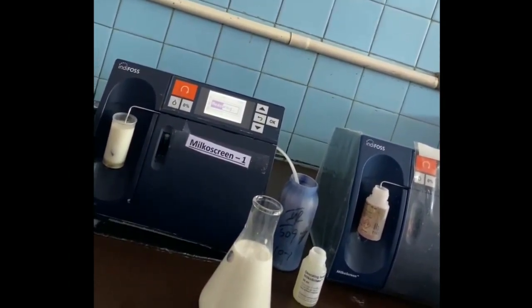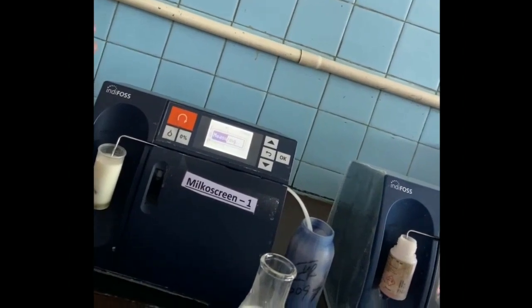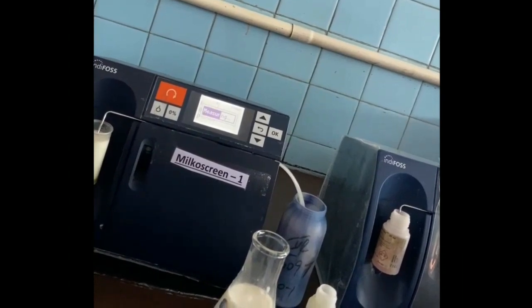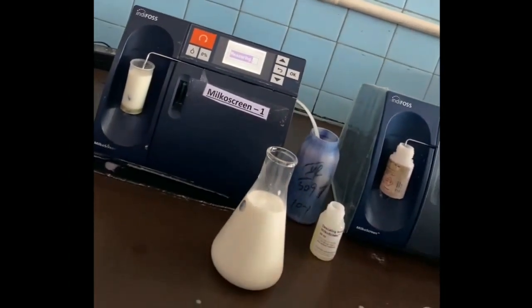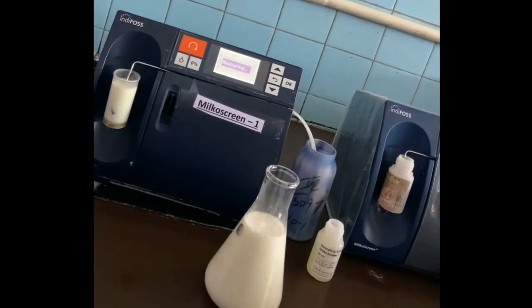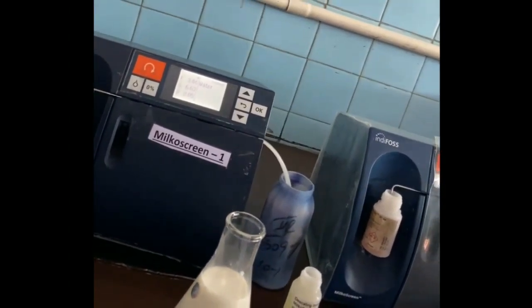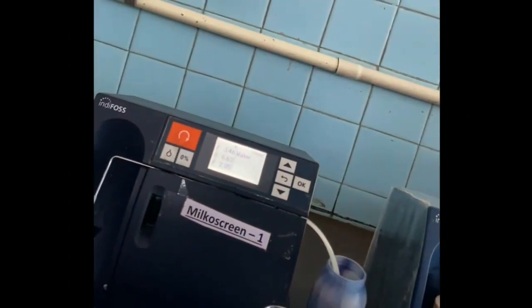Using this device we can find around six kinds of adulterants. The process is almost done and now it will show the adulterant if any. Here you can see water is detected as an adulterant, and the fat, protein, and SNF values are also shown — these are low as per the standards. So we can say that there is an adulterant present.